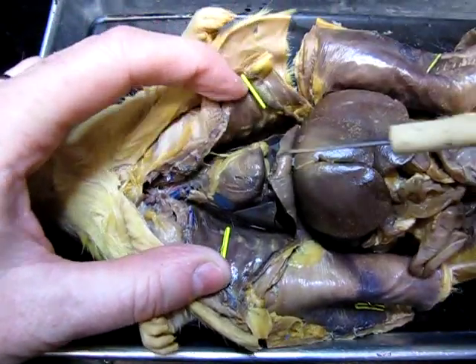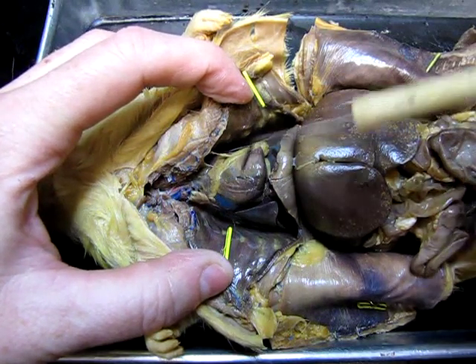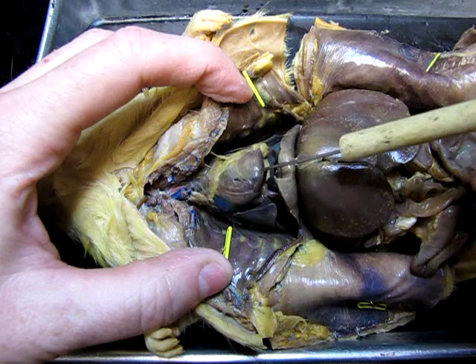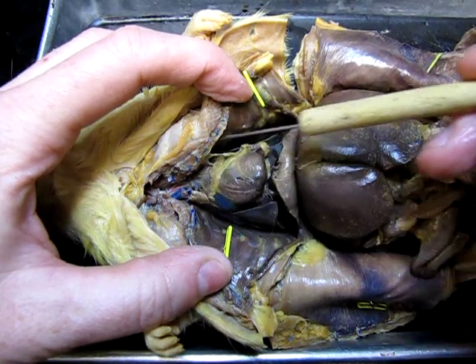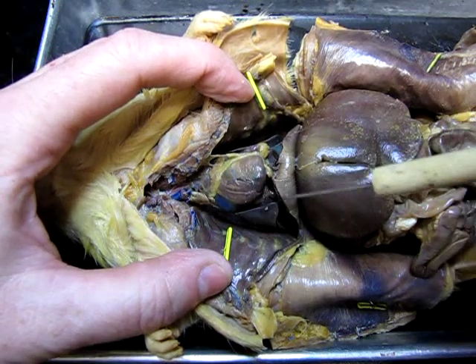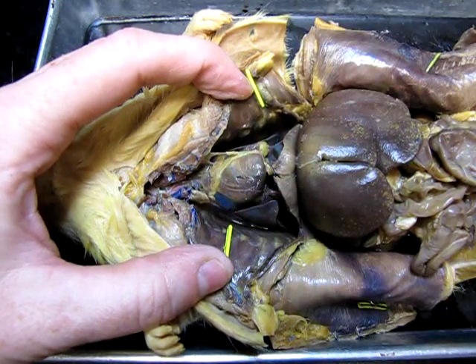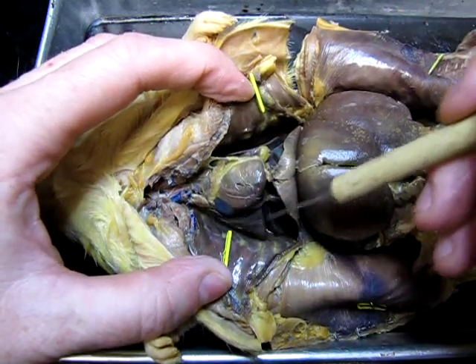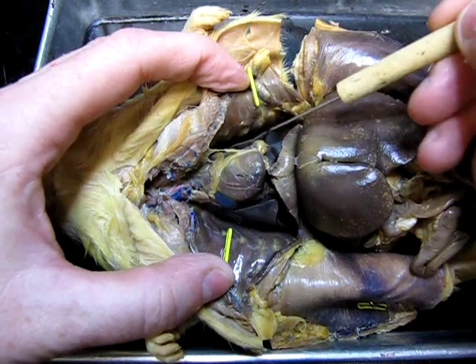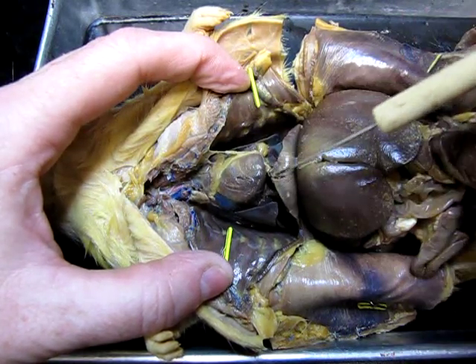Again, back up here in the thoracic cavity, the top part of the cavity, we find a couple of structures. Centrally located here is this large organ, that's the four-chambered heart. On either side of that four-chambered heart, we can find the lobes of the lungs. So here are some lungs, and here are some lungs, and on the other side as well. The lungs and the heart are housed in this thoracic cavity.